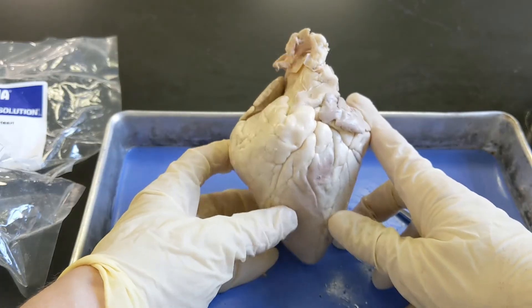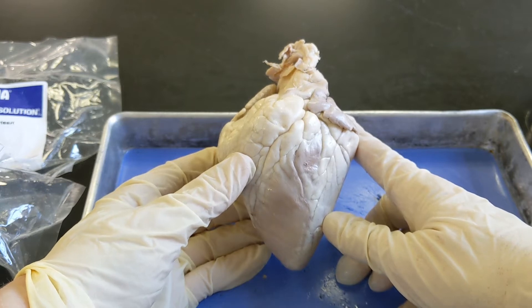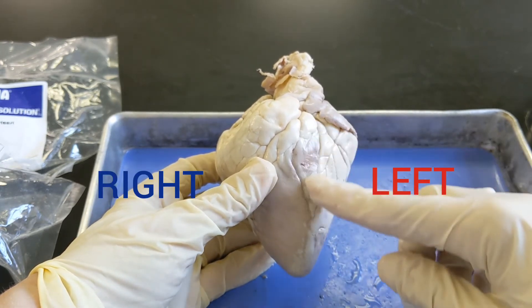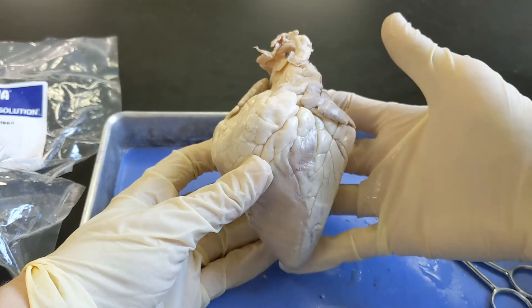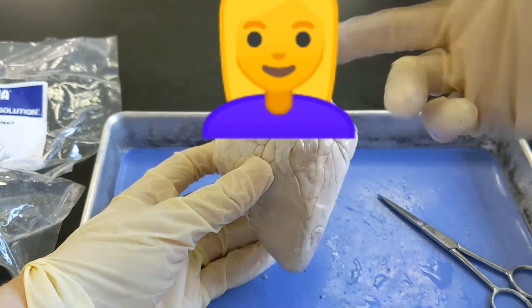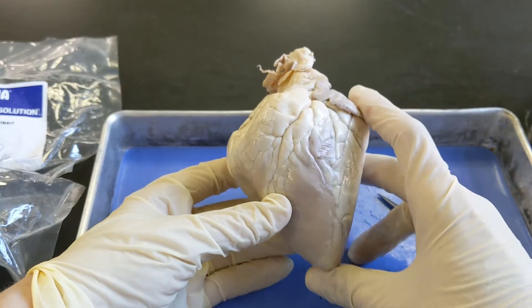When you're looking at this heart, think about what's the right side and what's the left side. If you answered that this is the left side of the heart, you're correct. Even though it looks like the right on screen, remember you have to look at it as though this were a person and you're looking at their face — so everything is backwards. Their right side is on your left and their left side is on your right.